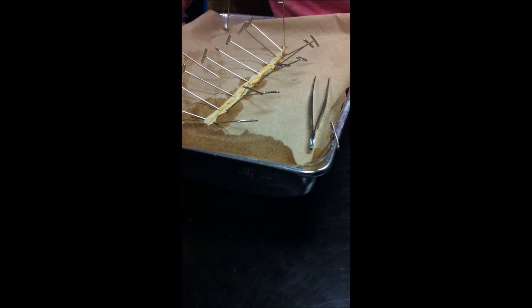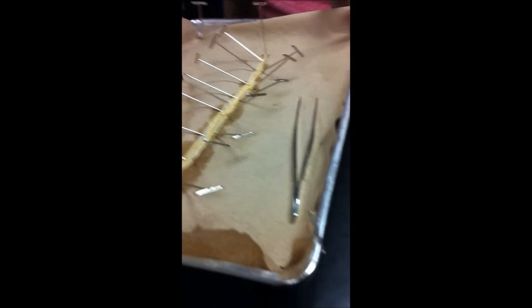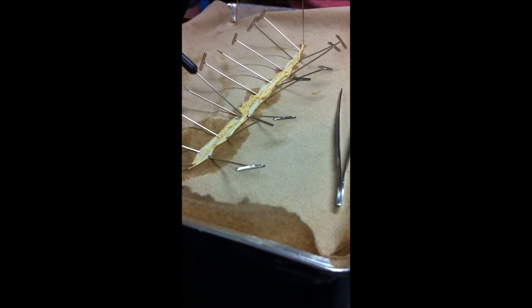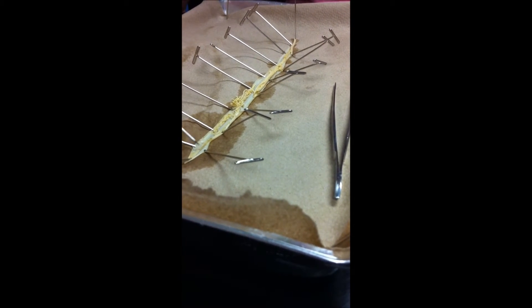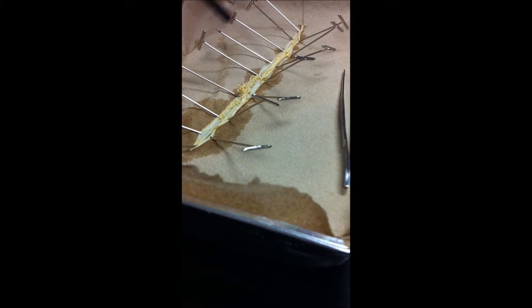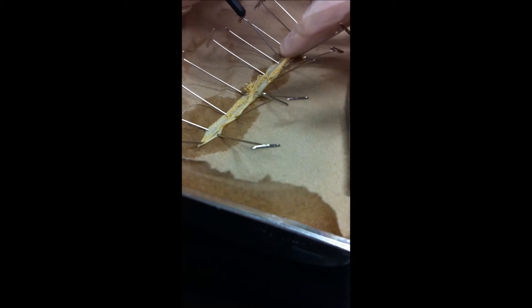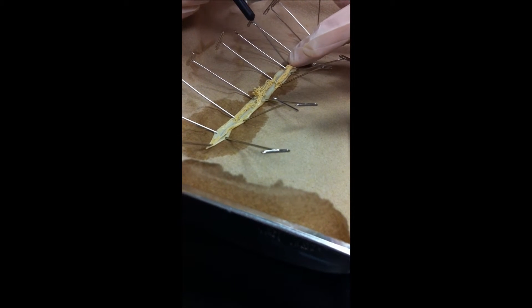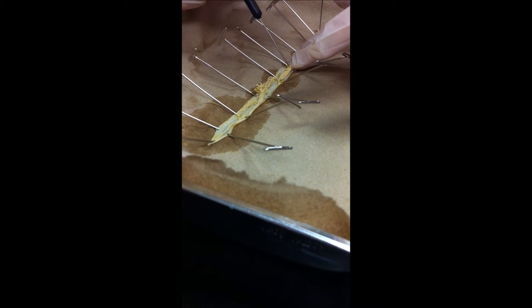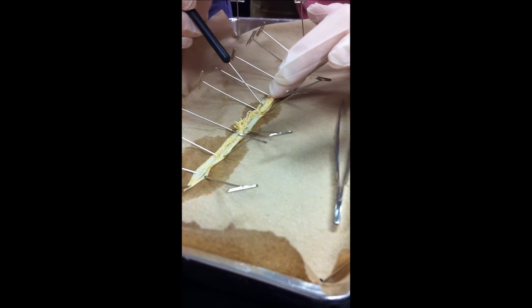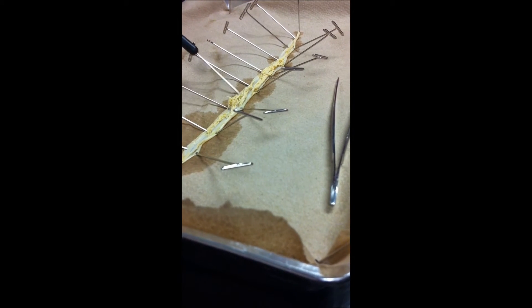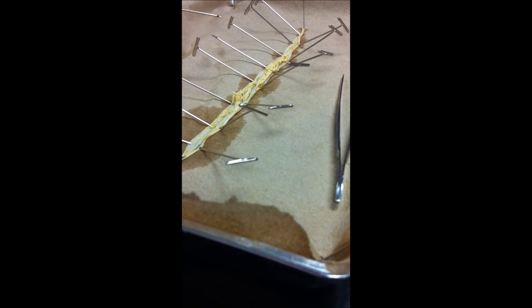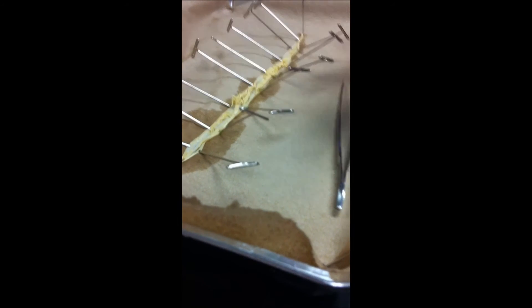So, let's talk about the insides now. All this really fine kind of stuff, all through here, it looks like noodles. The fine noodles. All of that is reproductive. There's a thicker one that we can kind of see here. It's already starting to dry out. And then it runs, it comes back down here, and it kind of runs in between all of this stuff here. So I was able to pull these little layers off. You can see the thicker one right here, and that's the intestine. So this is the reproductive and intestine, that's all that's in there. No, there's no liver, kidneys, there's none of that stuff. There's literally an intestine for the entire way down, and reproductiveness, and that's it.